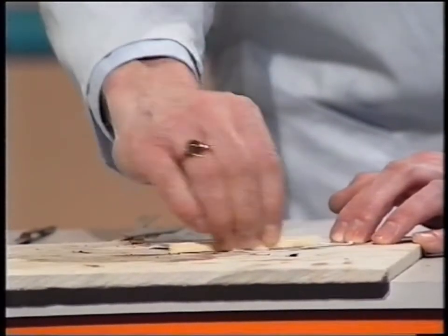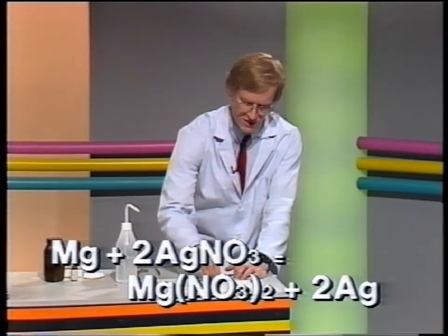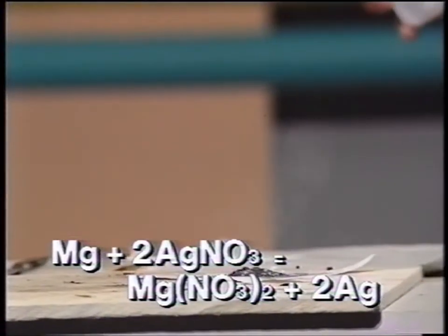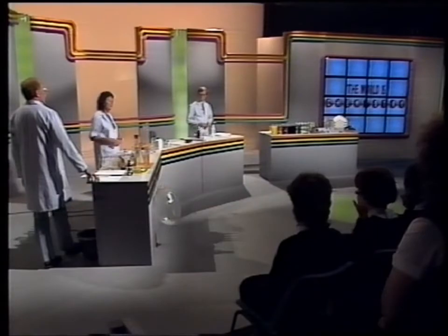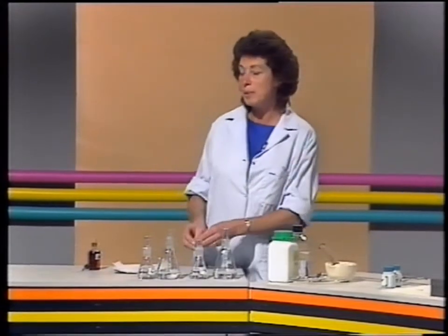If we make the particles mix together by adding some water, it'll dissolve the silver nitrate, and hopefully you'll see a fairly vigorous reaction. That is a reaction where, because the particles can move, it suddenly takes off. And so it's all to do with the collisions between numbers of particles.